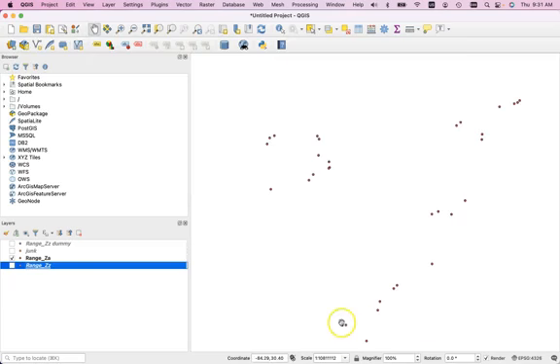And then what I would do is I would color code all of these individuals as belonging to either one region or the other, or call them populations. So in this rarefied data set, I would only have two populations, this one and this one. And then I would run SAMOVA on it to tell you if in fact it's true that this is one distinct region genetically and geographically, and this is another distinct region genetically and geographically.